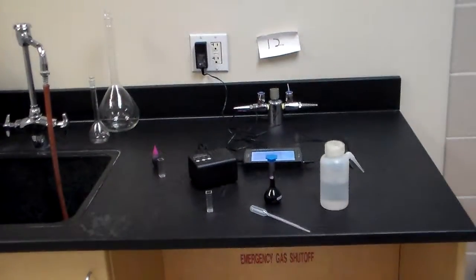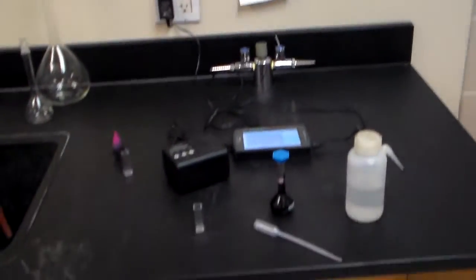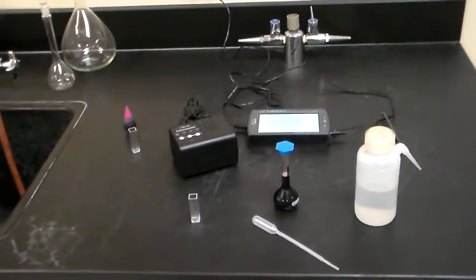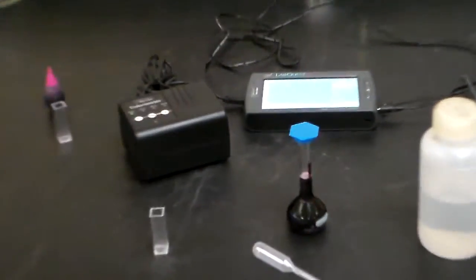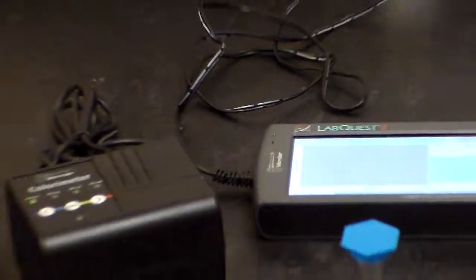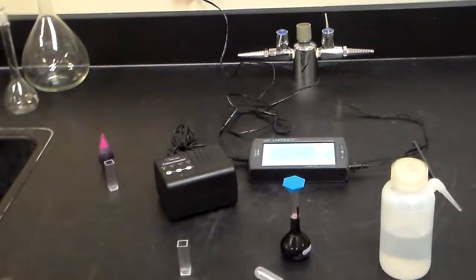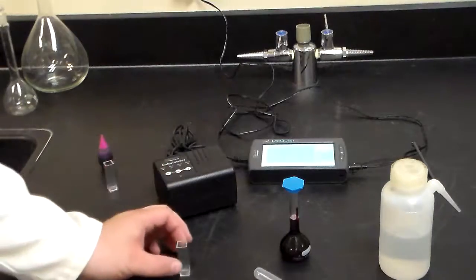And now we're going to shift back down here. What do we do next? What's our next thing that we're going to do? I'm going to show you guys, got to talk to you guys about the cuvette. Okay, and that's it right here. I'm going to kick this up a little bit more. Remember, I am a one-man team, and since I'm a one-man team, that does make it a little bit more of a challenge.